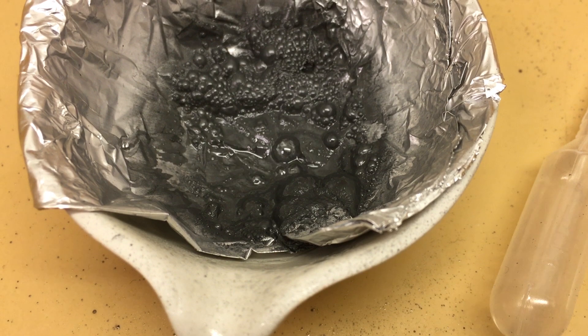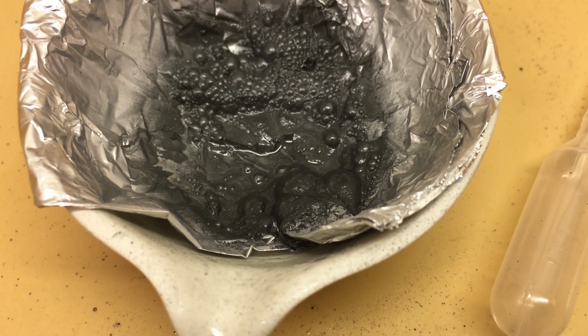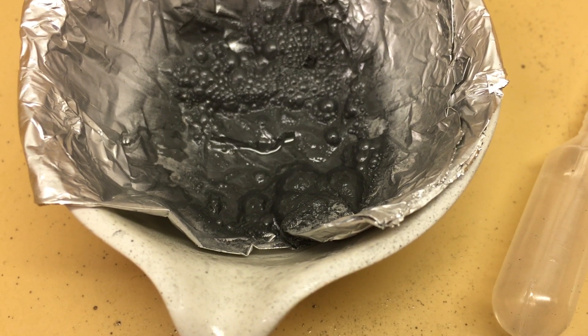There's a reaction between hydrochloric acid and aluminum, which bubbled up and made it into a blackish and grayish sludge. We had leftover aluminum, but all the hydrochloric acid was used up.